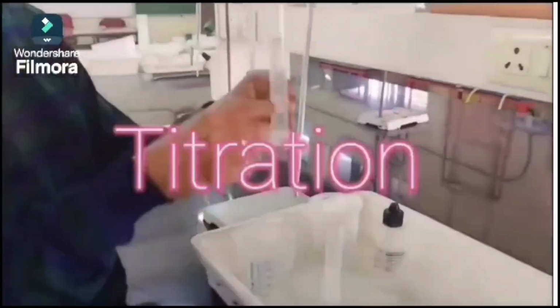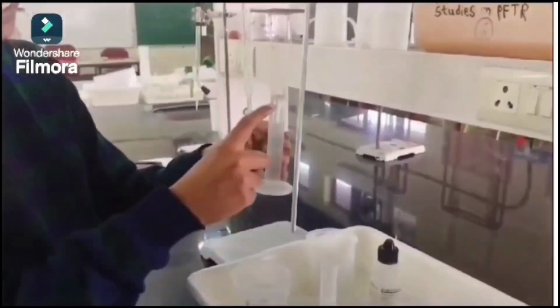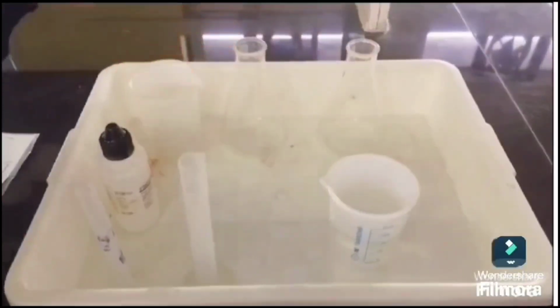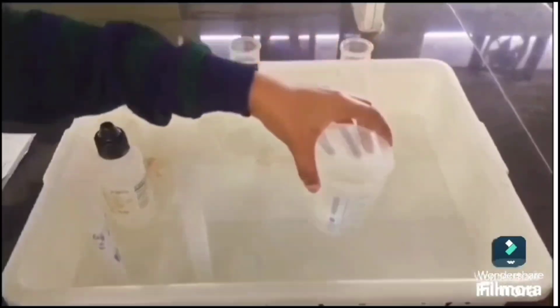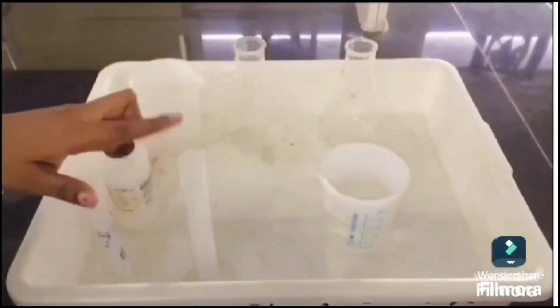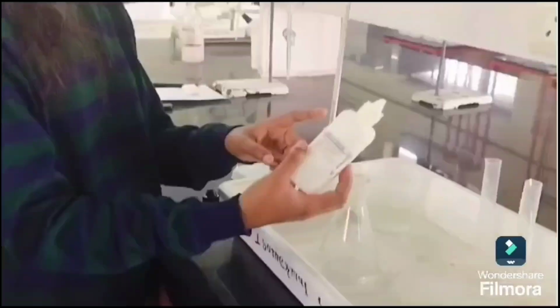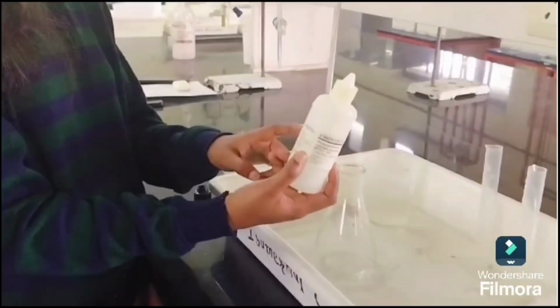This is the experimental setup for the titration of the sample. These two are the conical flasks. Here is a beaker which is filled with sodium hydroxide solution. These two are the measuring cylinders. In these we collect the sample and hydrochloric acid. This is a phenolphthalein indicator.